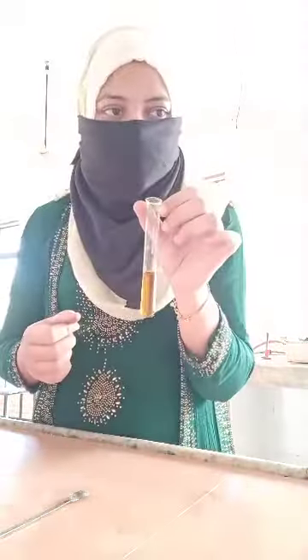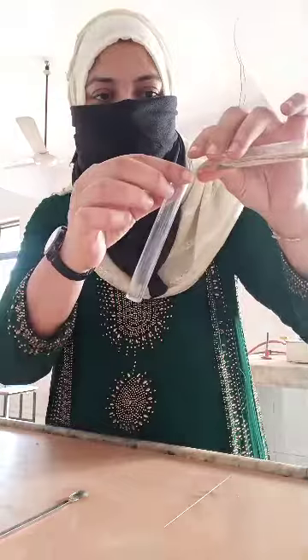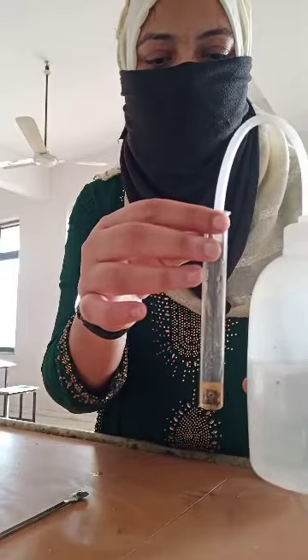Next, the test which we have to do is with your FeCl3 solution. Let me show you — this is your FeCl3 solution. What we have to do? We have to take our organic compound. I am adding a little water because we have to dissolve our organic compound. Then we have to add the FeCl3 solution.